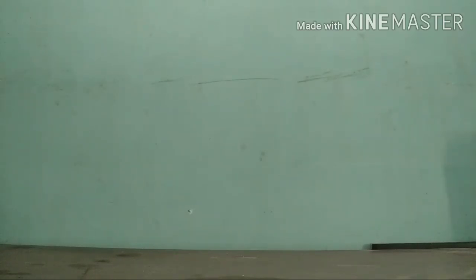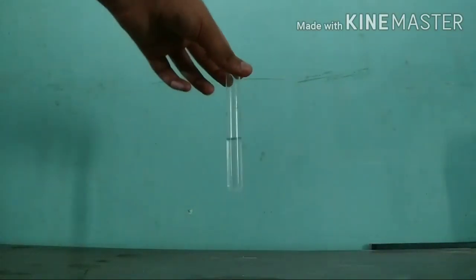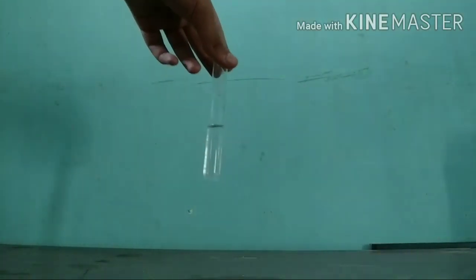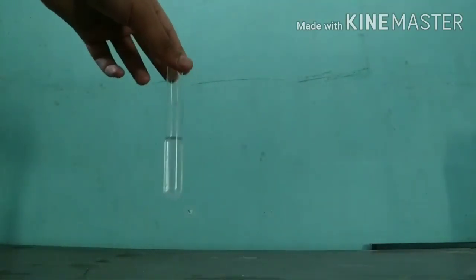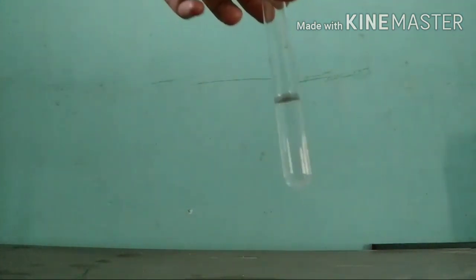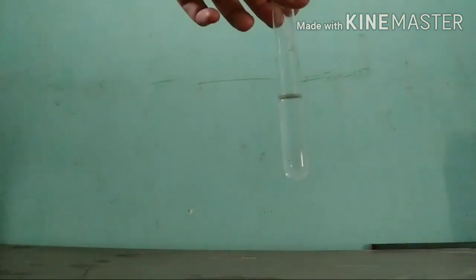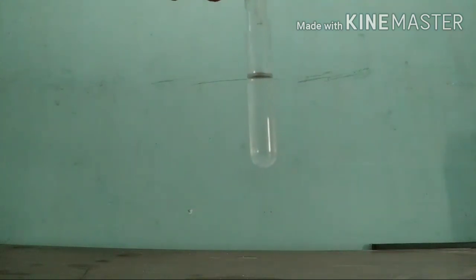Hello friends, today we will create ammonium carbonate. For that we require ammonium hydroxide, which I have created in a previous video, and we will also require some sodium carbonate. So let me just add some sodium carbonate into this ammonia.